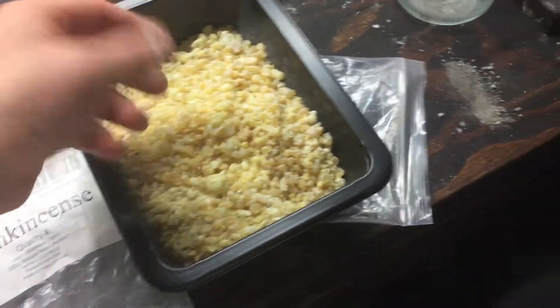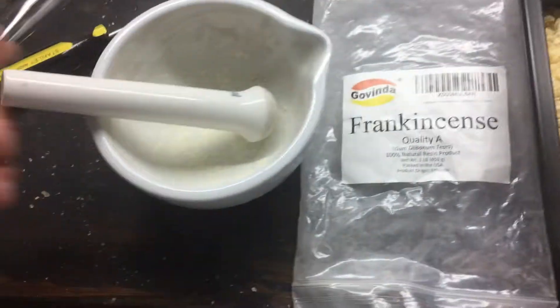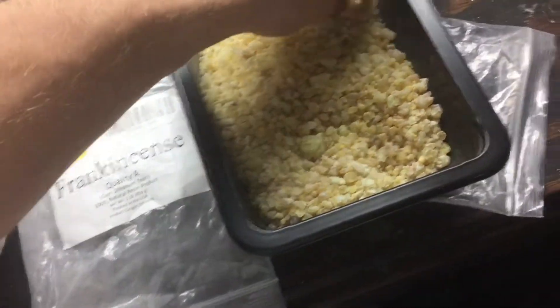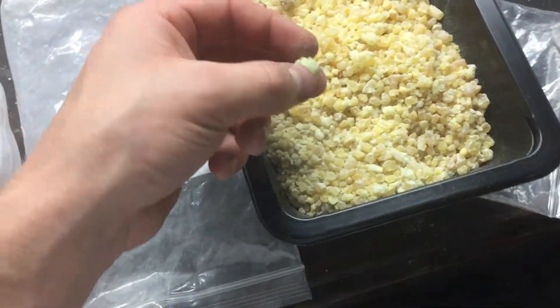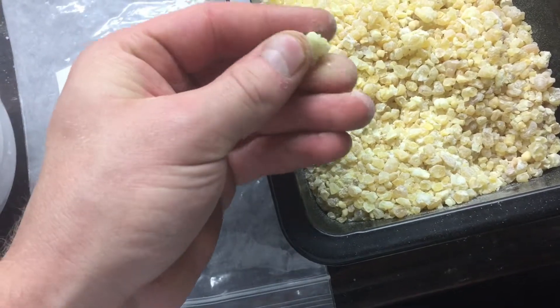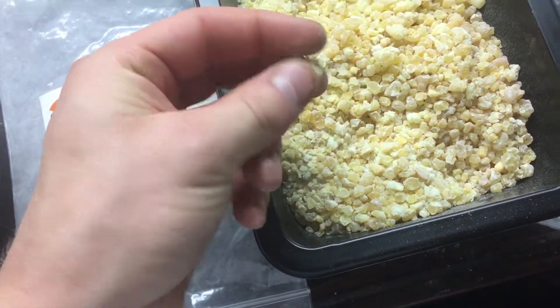Same as last time, I'm going to need to pulverize it into fine powder so that I can steam distill it more easily than the large chunks, which will probably account for a lower yield. Here's the frankincense powder — or chunks I suppose. I pulverized them using my mortar and pestle and it was quite difficult to some extent because, as you can see by a few of these little pieces, they're fairly bendy or resinous.